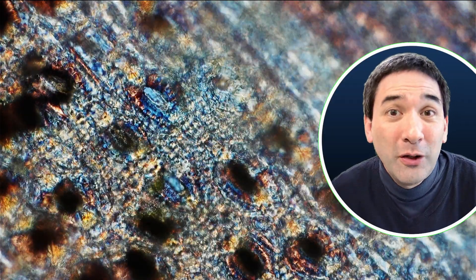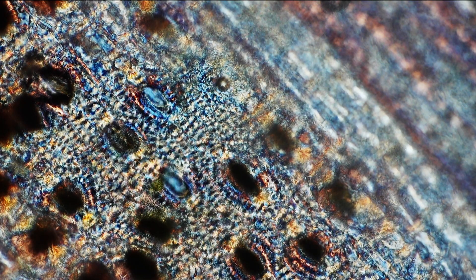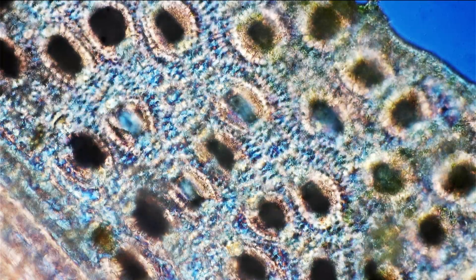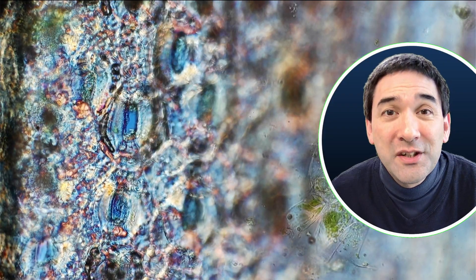Unfortunately, it's not only oxygen that is able to exit, but also water vapor. So stomates are actually one of the ways a leaf can lose quite a bit of water. For this reason, they are able to open and close — when they close, water vapor cannot be lost, which helps the plant withstand periods of dryness. Usually they close during nighttime when there is no sunlight and the plant is not able to do photosynthesis. Here we can see some of those oval openings. There are two cells called guard cells to the left and right of each stomate, and those guard cells control the opening and closing of the central hole, allowing control of gas exchange.